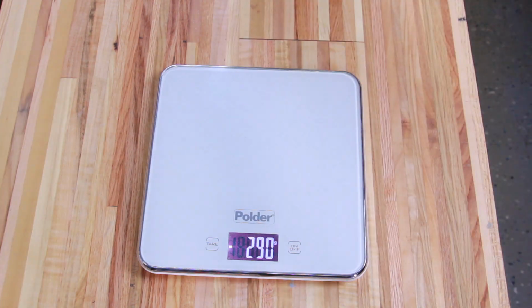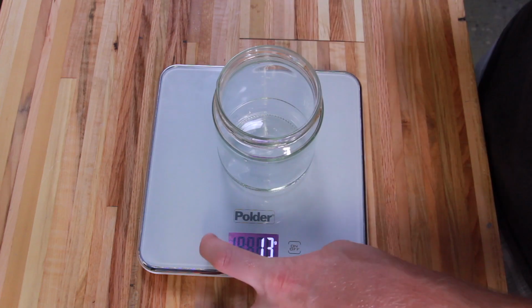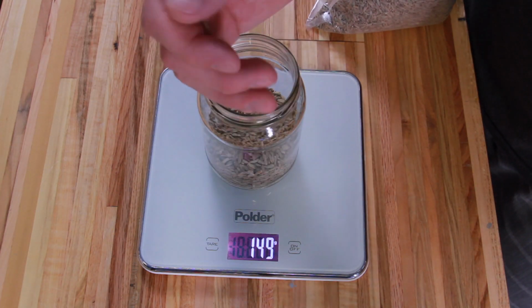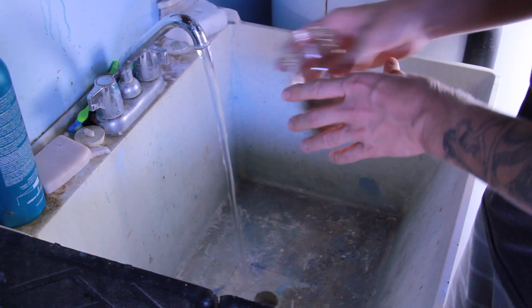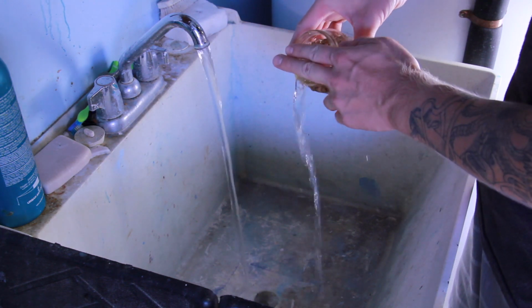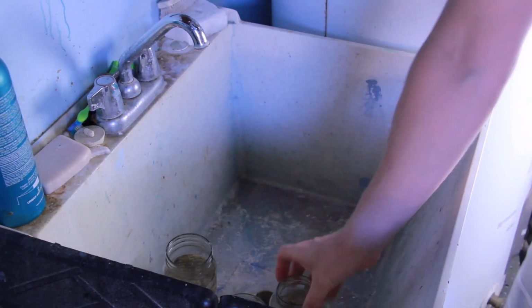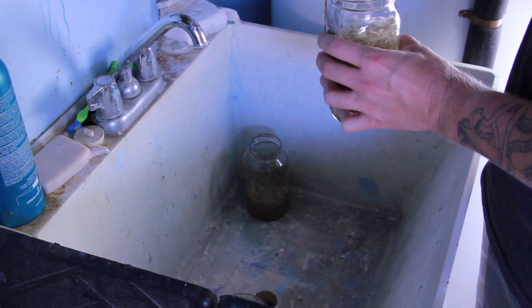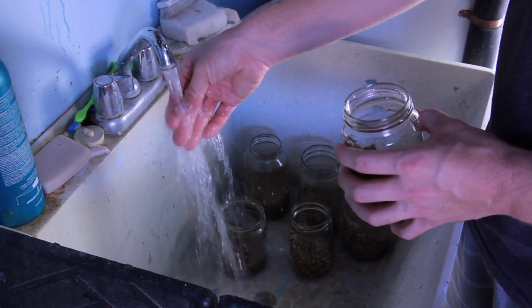I then measured out 150 grams of dried rye grain for each of my 6 jars. I took the jars over to the sink and gave each one of the jars a single rinse. Then I got my tap water as hot as I could get it and filled each jar to soak overnight.